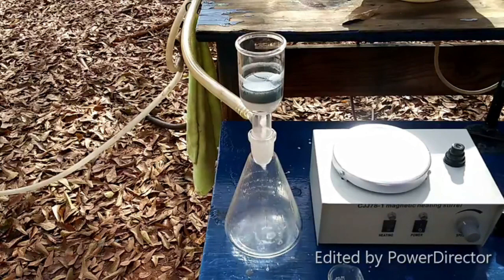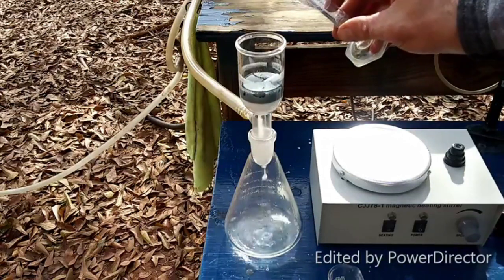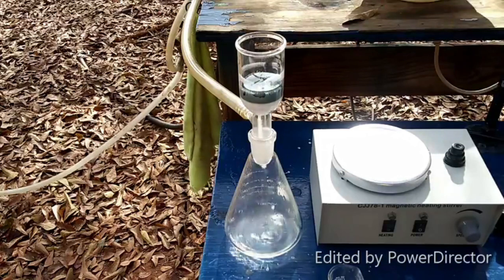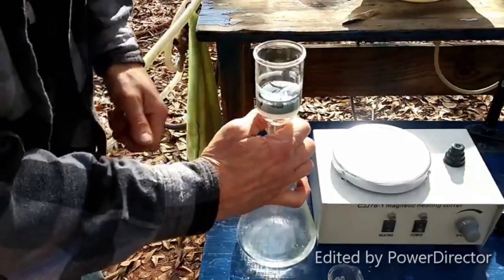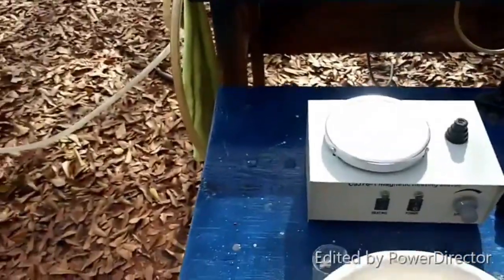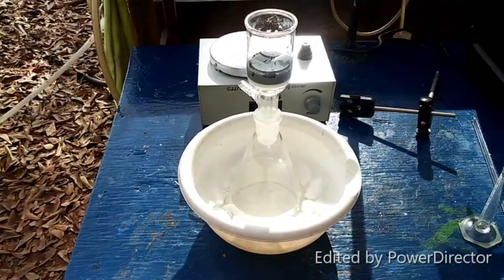The protocol says to wash this with two five-milliliter portions of water, so I'm going to go ahead and do that. The zinc has changed color a little bit, which is encouraging. We've filtered off the solid — not sure if that was premature, but the only way to find out is to go through the motions and see if this works. If not, we'll figure out what we did wrong and come back to it.